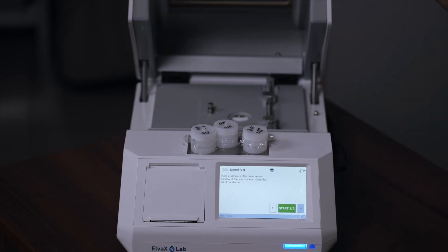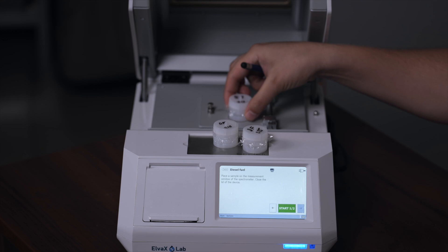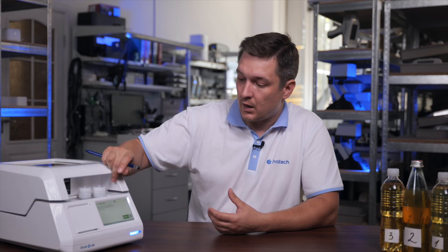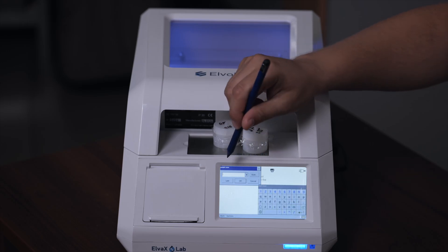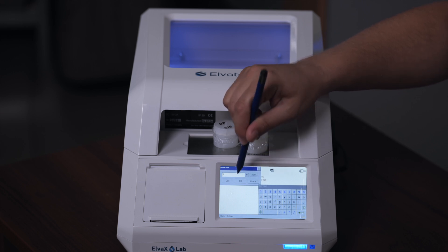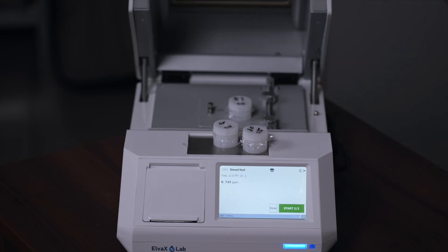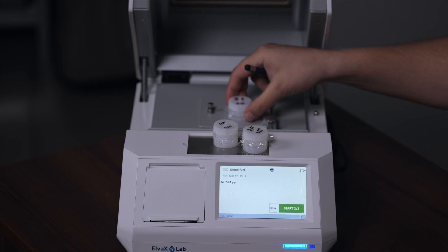Now let's place the first sample of our diesel fuel using the sample cups and start the analysis. We need to enter the sample name — we will name it 'first' and confirm. Our analysis has come to an end and now we see the results of the first sample.